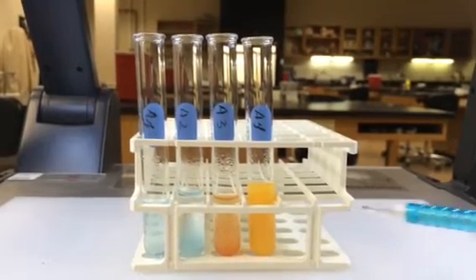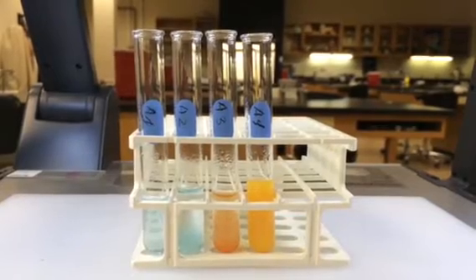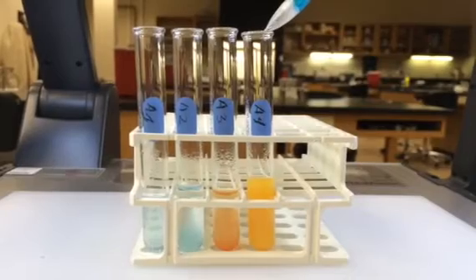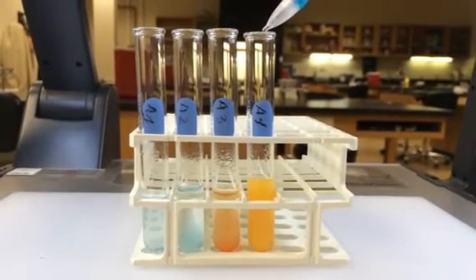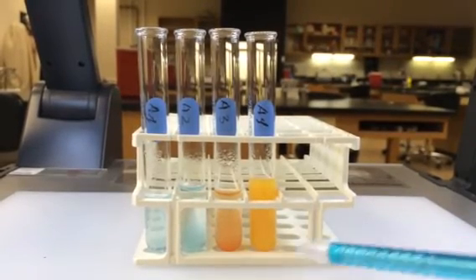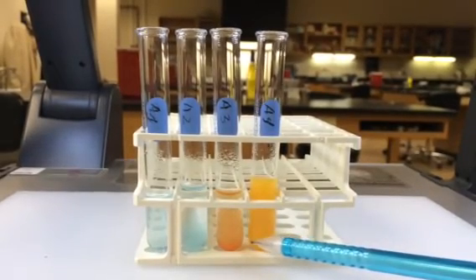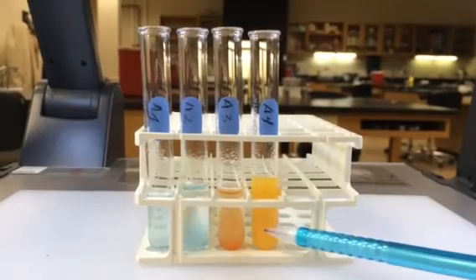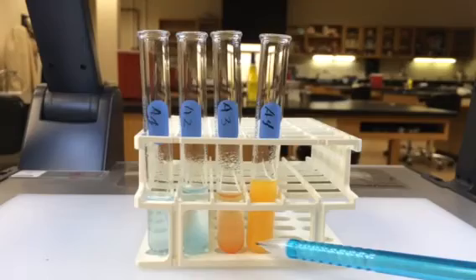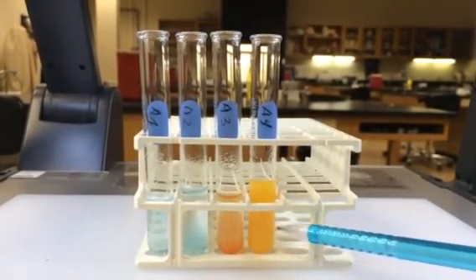In tube A4, we mixed amylase with a starch solution and incubated it for 60 minutes at 37 degrees Celsius, then tested it for the presence of maltose. This is the result we wanted to see — it indicates that maltose is present, meaning the starch, in which maltose was originally absent, was digested down to maltose. That's what we're seeing in tube A4.